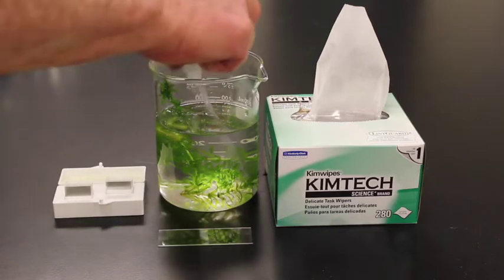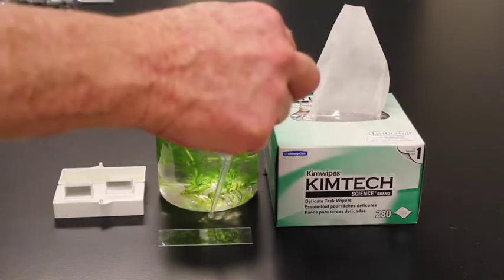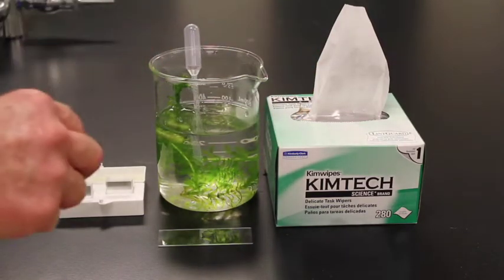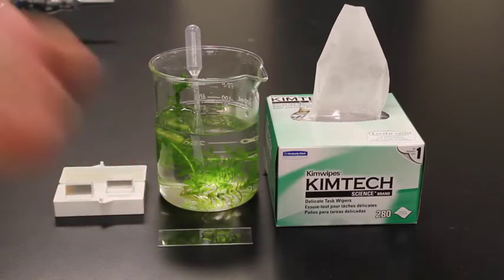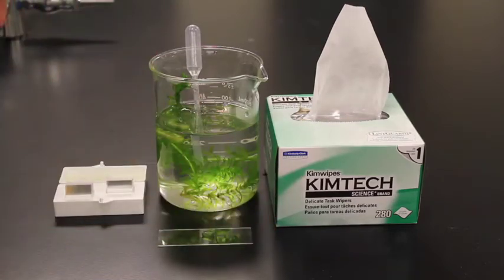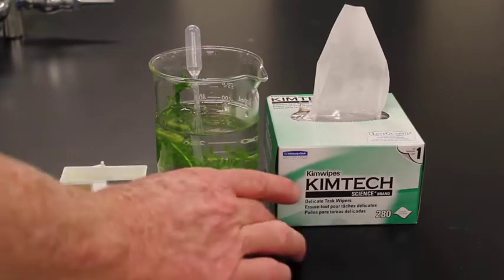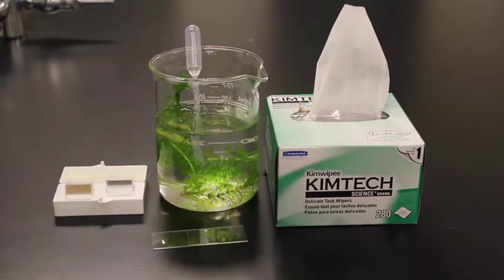We put the leaf down and stick it down on the slide. Then I'm going to take my eyedropper, get a drop of water, and put that right on top. Now I'm going to grab a cover slip — just one cover slip, not two — and gently put the cover slip down on top. And here is our wet mount all ready to go.